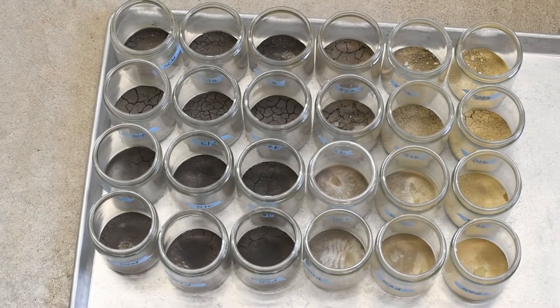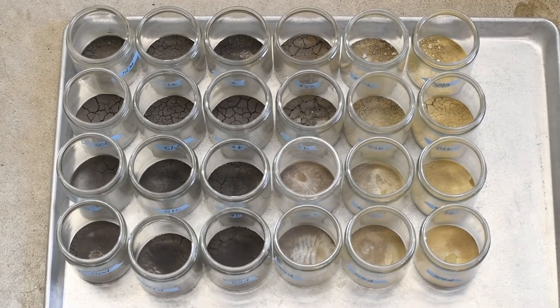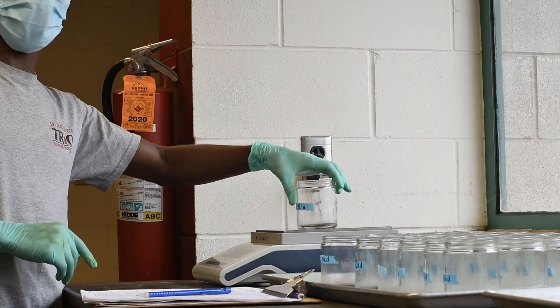When the aggregates are dry, remove the samples from the oven and allow them to come to room temperature. Then, weigh and record each sample.